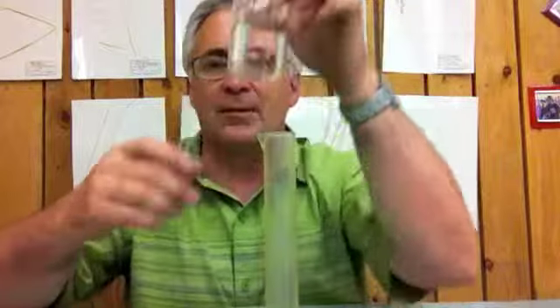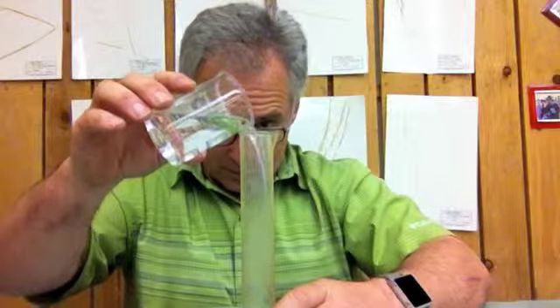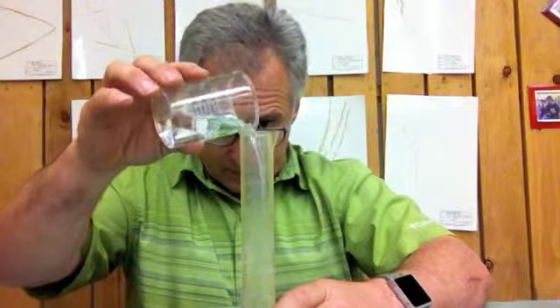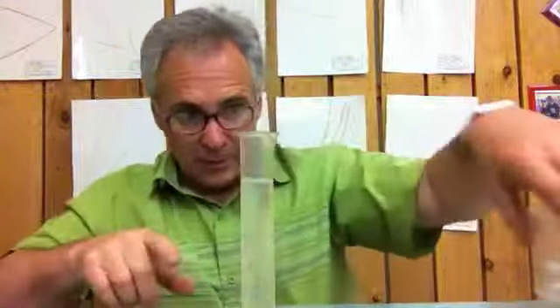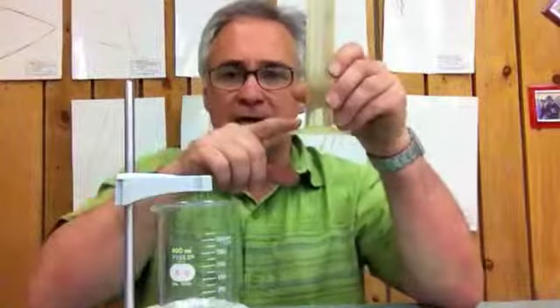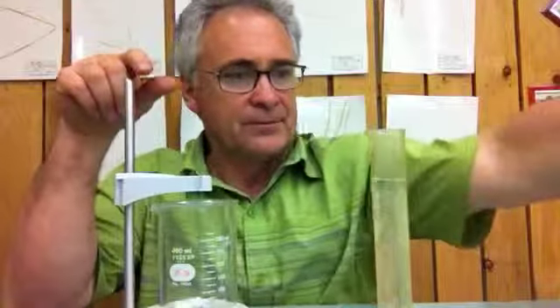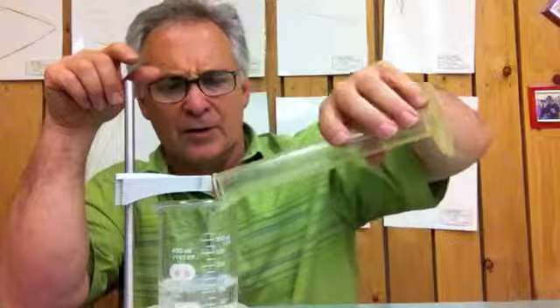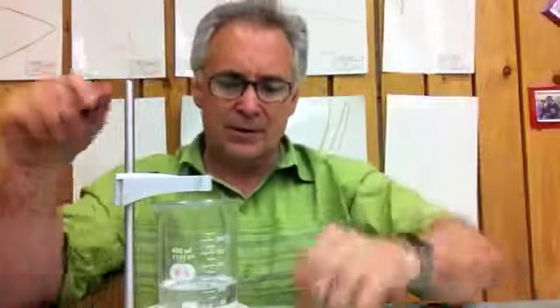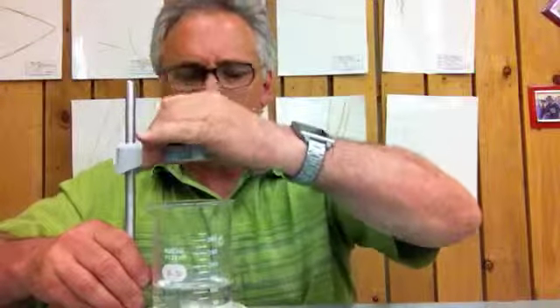Now I've poured a little bit of the club soda in this smaller beaker, and I'm going to pour out 100. And when the bottom of the meniscus is on the top line, the 100, I've got that. So I've got 100 mLs of my club soda. I'm going to pour this right in the 200 to 400 ml beaker. In this case, this happens to be 400. Got that all done. I put it on my stir plate. I've got my stir plate with the ring stand built in here.